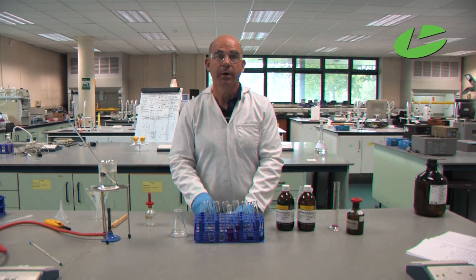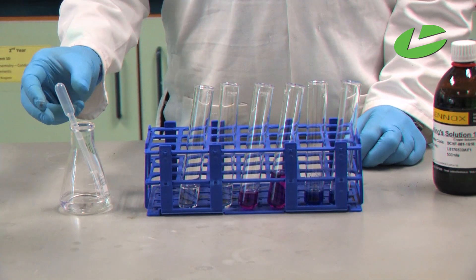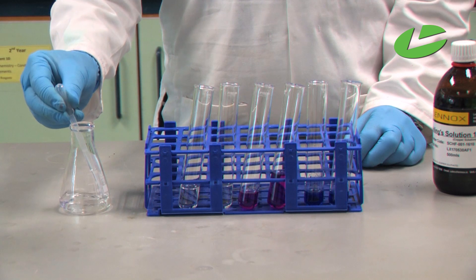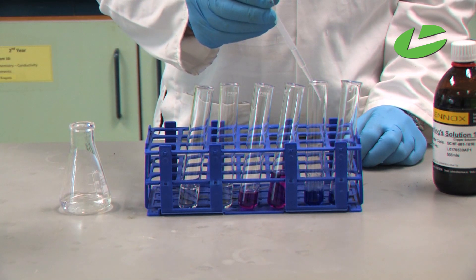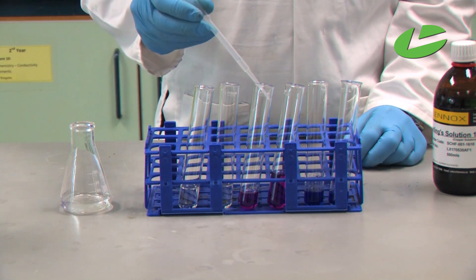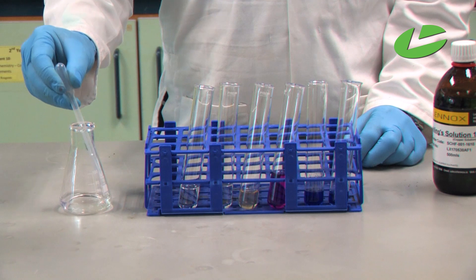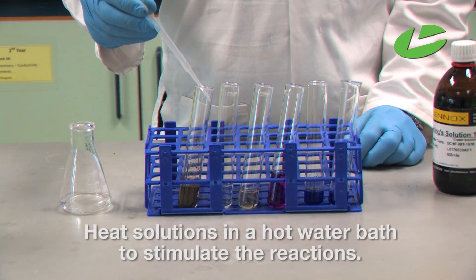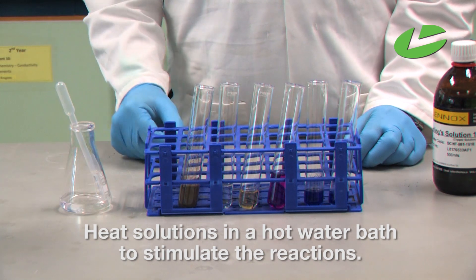Now my three reagents for testing are created. I am now going to add one milliliter of my aldehyde solution into each to check for the presence of an aldehyde. Now I am going to heat these three solutions in my hot water bath.